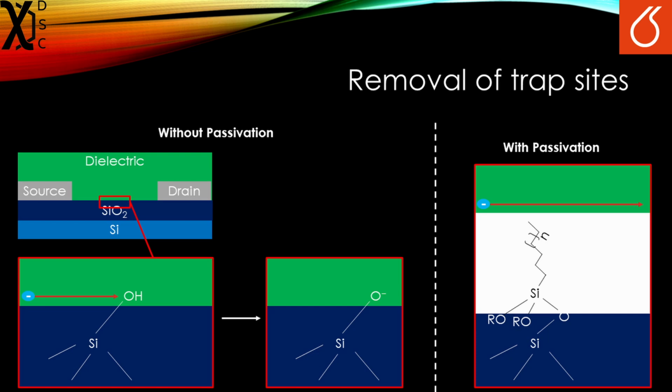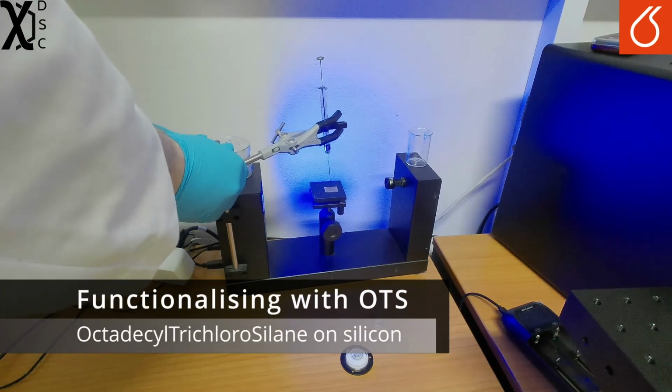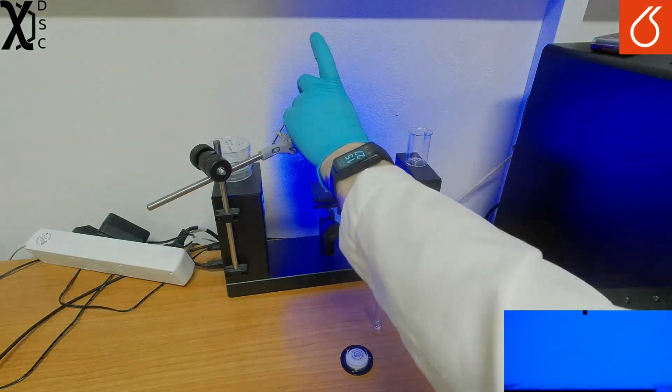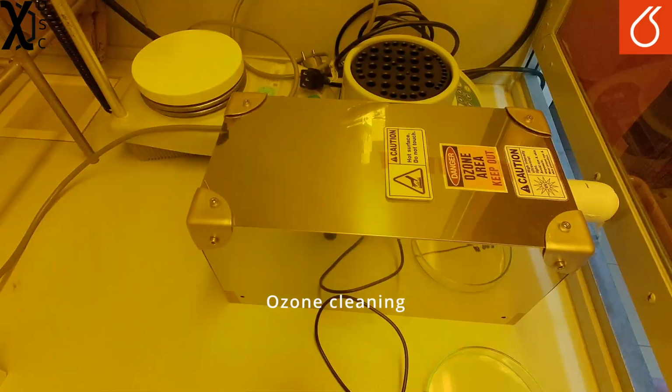OTS is notable for its hydrophobicity. Silicon oxide is quite hydrophilic, however. As such, a quick way to gauge the effectiveness of the passivation is to measure the contact angle of a drop of water before and after passivation. Here is before. Before passivating with OTS, it is first necessary to burn off organic impurities present on the surface.